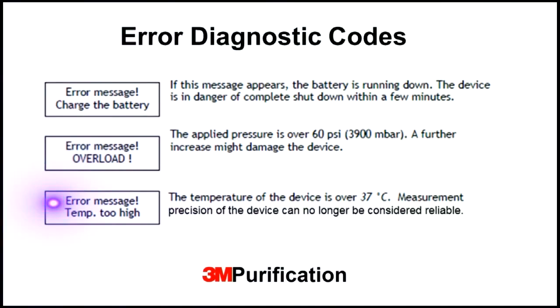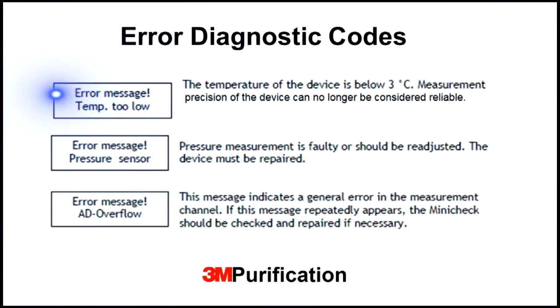This message is an indication that the maximum recommended device operating temperature has been exceeded. Note the resulting measurements are potentially no longer reliable. This message is an indication that the minimum recommended device operating temperature has been exceeded. Note that resulting measurements are potentially no longer reliable. This message is an indication that the pressure measurement yielded by the device is no longer reliable. This message is an indication that a measurement error is present. For either of these error messages, contact 3M Purification technical support.